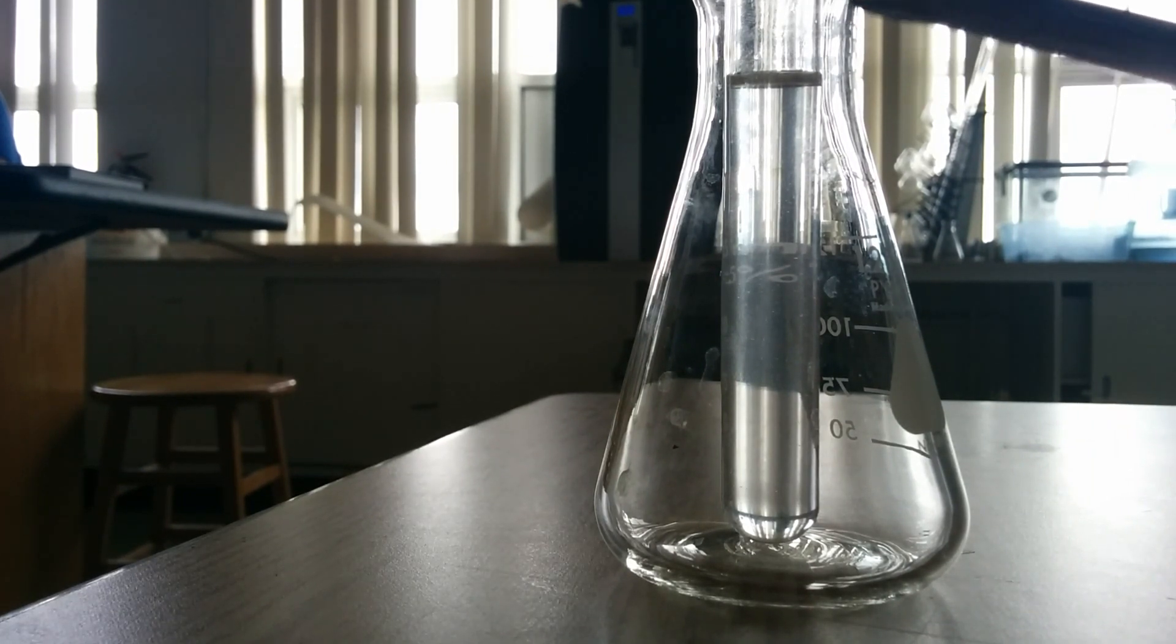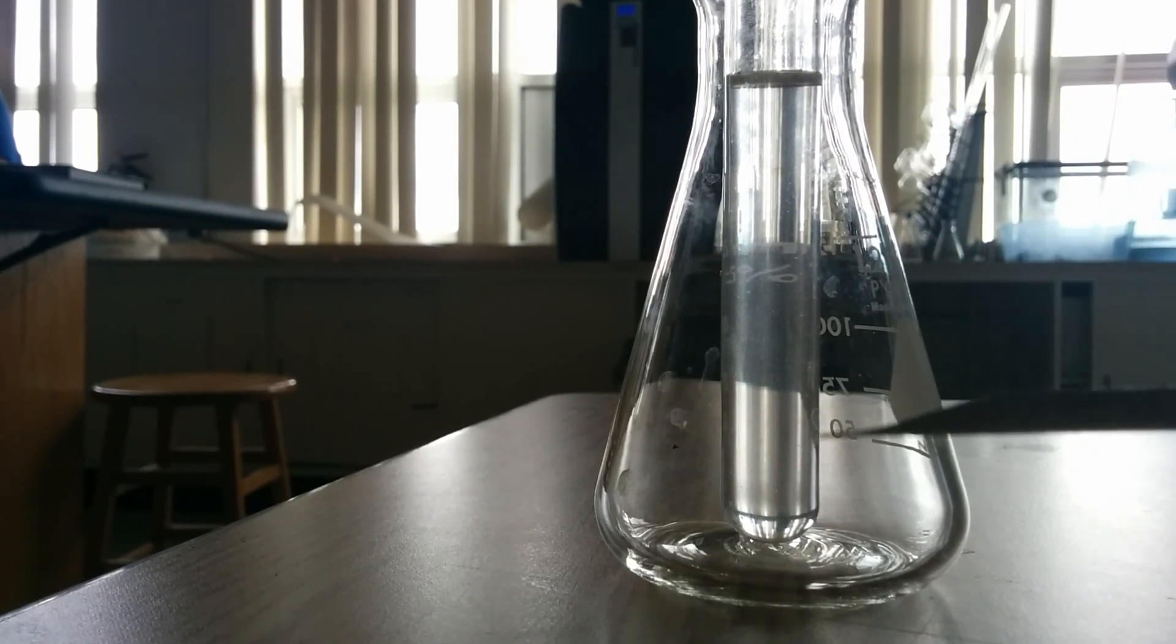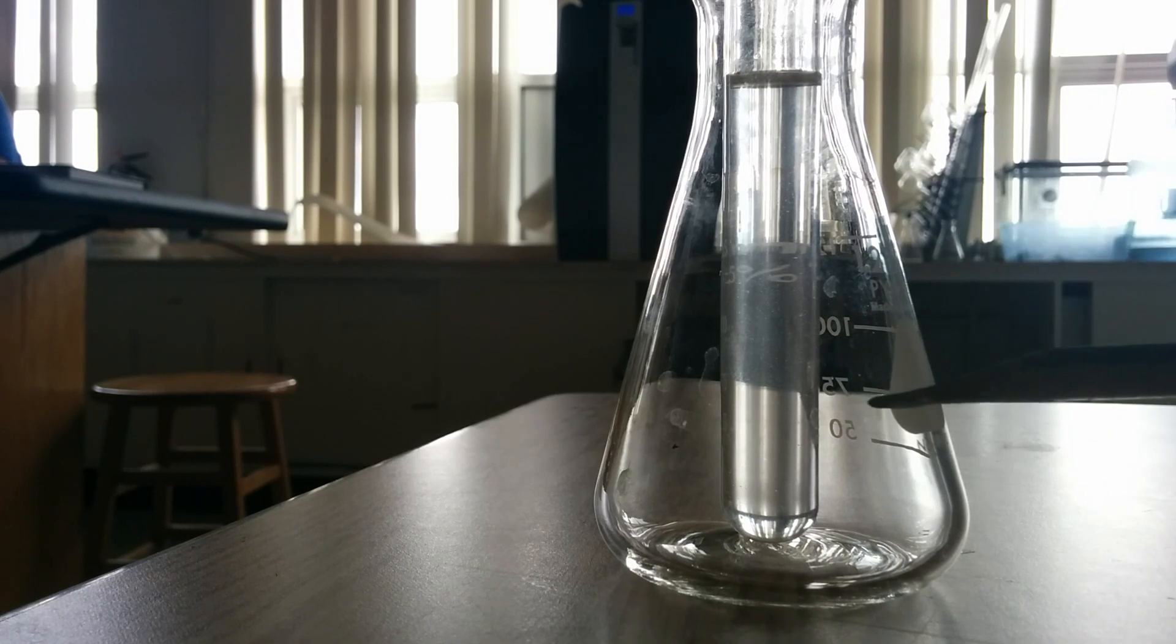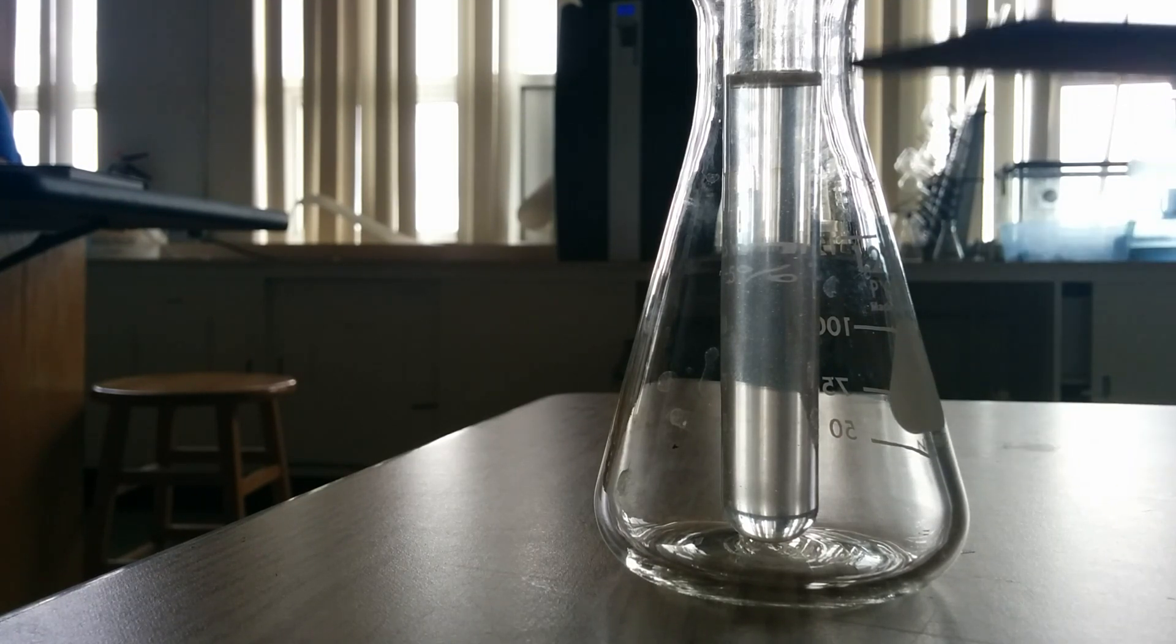We've dissolved as much sodium acetate as we could at 25 degrees Celsius, room temperature. Then we heated it so that all the solid dissolved.